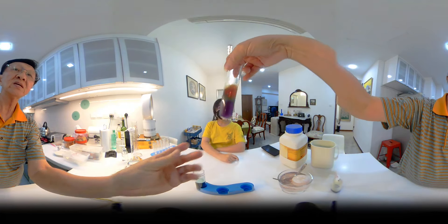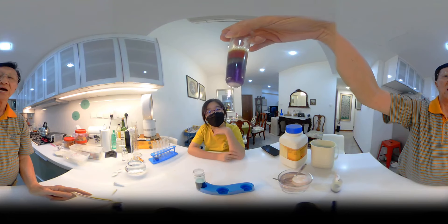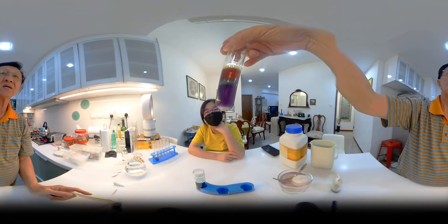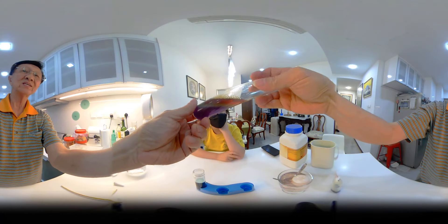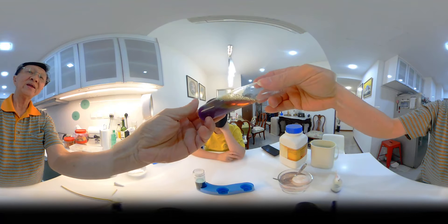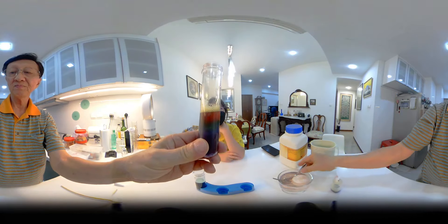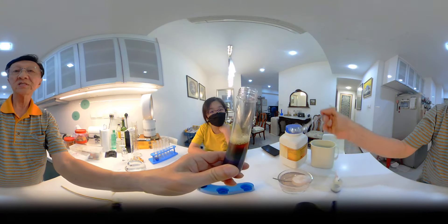Now, we are creating what we used to call a rainbow in the test tube. Rainbow in the test tube, and the color begins to become more distinct.